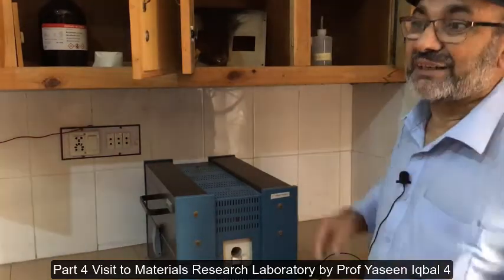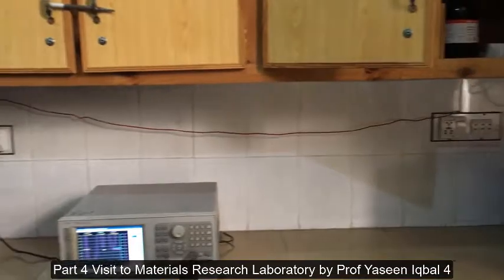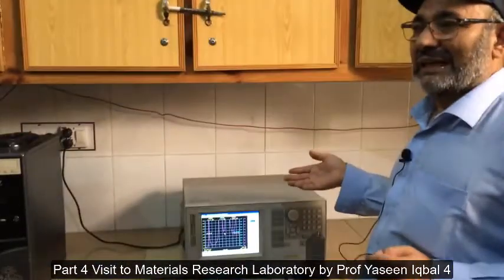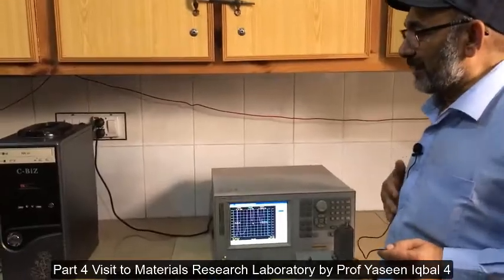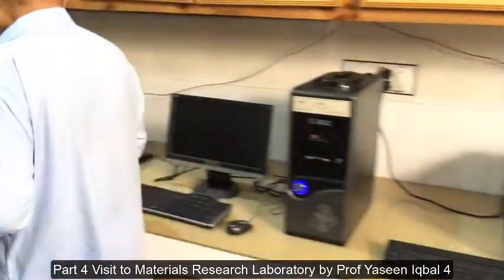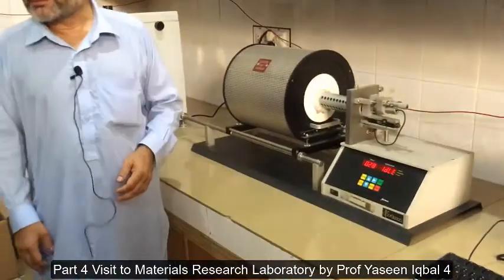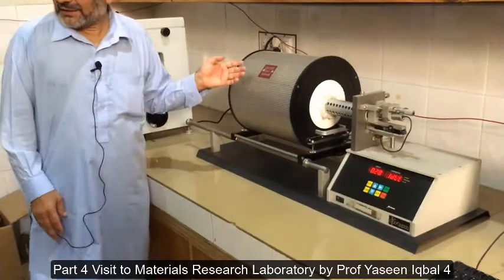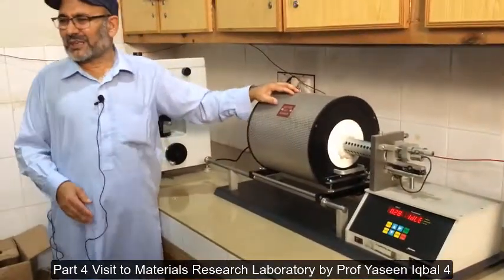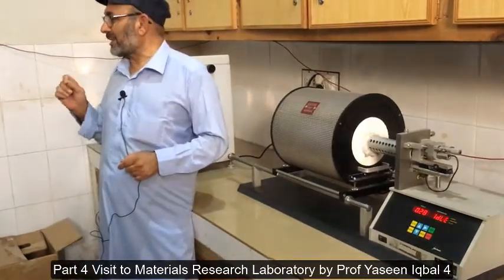This is a material analyzer and it does the same job for the dielectric constant and other properties of the material. This machine is called a glass dilatometer. The glass dilatometer does three things. First, it tells you about the glass transition temperature of the material.